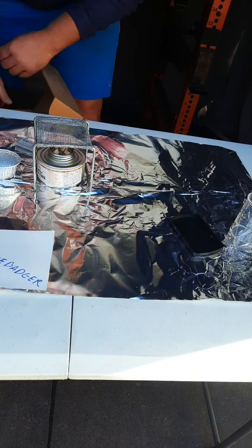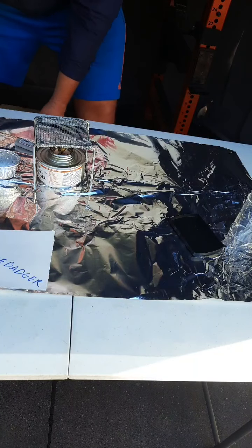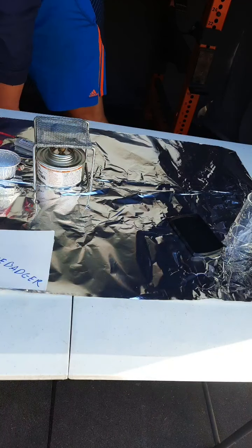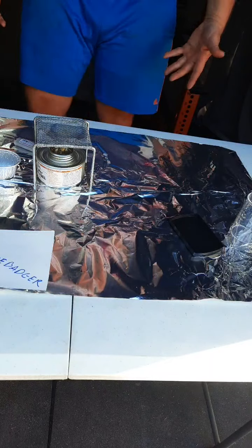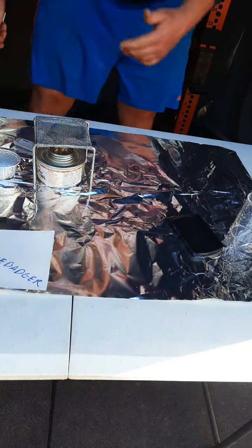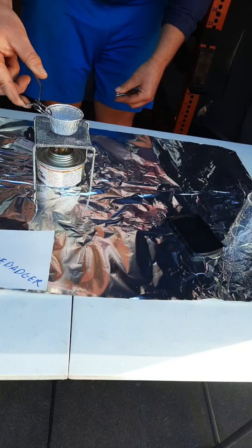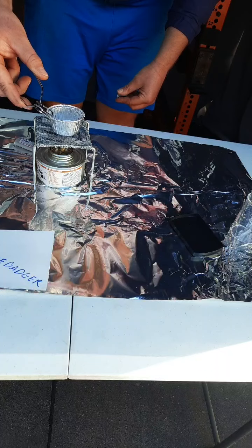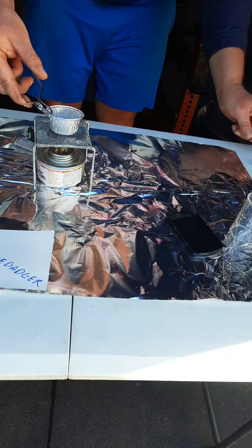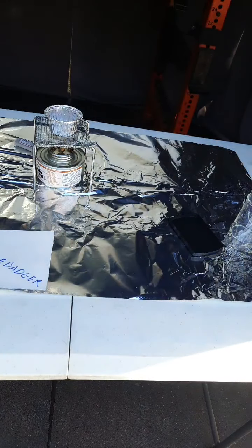Take that off. Boris is going to take it off for a minute just to kind of artificially slow it down. So remember, our goal is to just heat off the water. We are not trying to burn or melt the stuff. So we want to be careful. We don't want to melt things when it gets too hot.